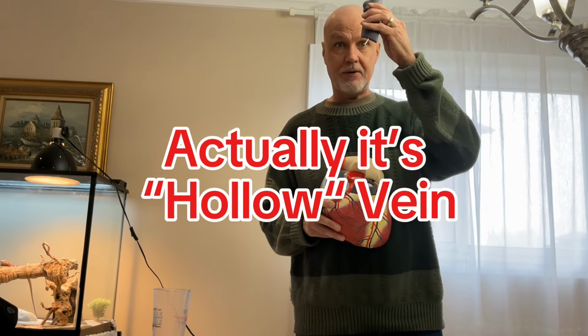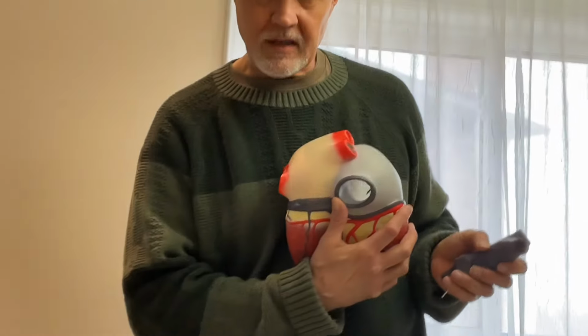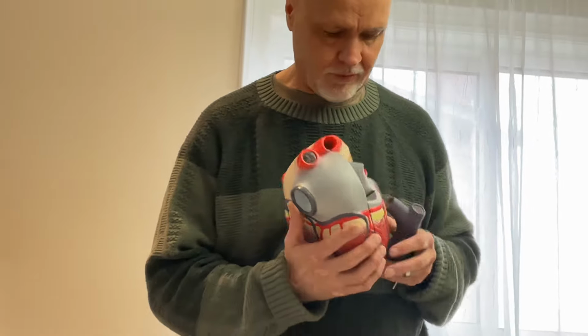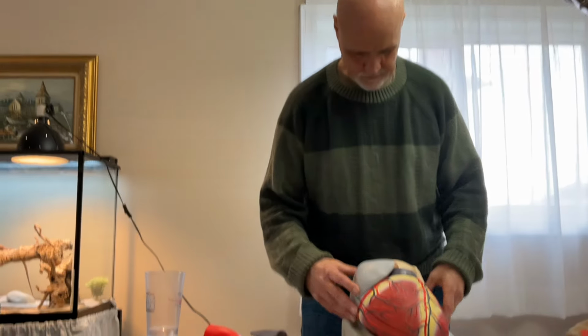Now, this is the superior vena cava, because it comes from above, superior. This is the inferior vena cava, because it comes from below. It's inferior. It's not really inferior, it just comes from below. Now, are you ready to get into the heart? I hope so. Here we are, we're getting inside the heart.